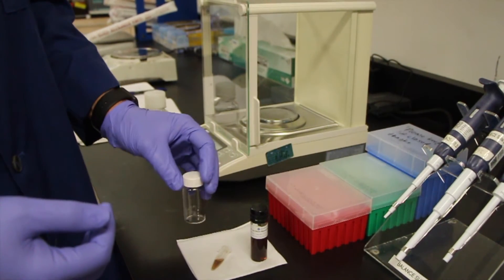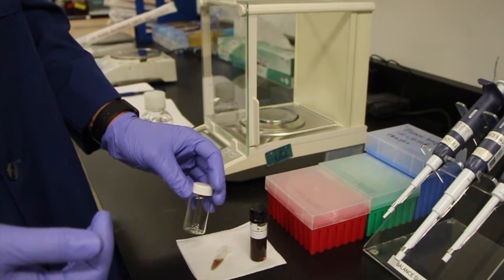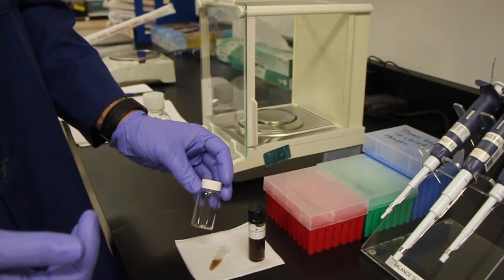Now that you're ready to prep your sample you'll want to weigh out the nanoparticle solution in a vial or bottle large enough to accommodate the final dilution volume.